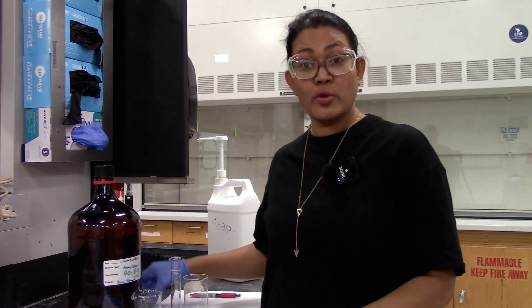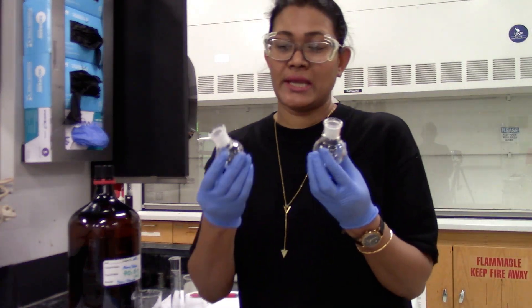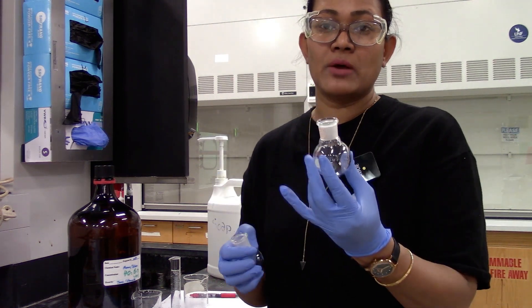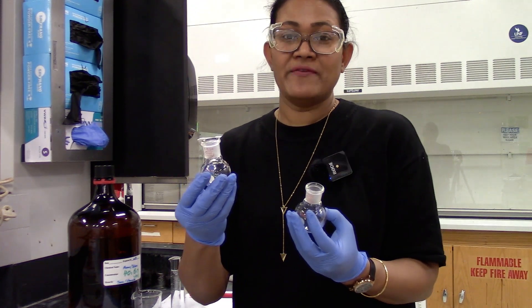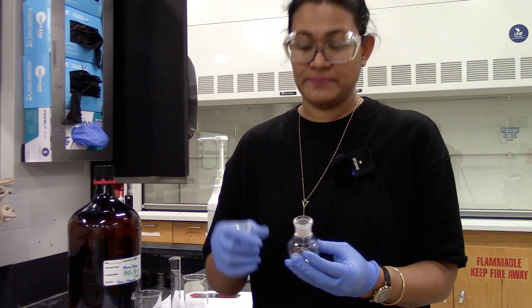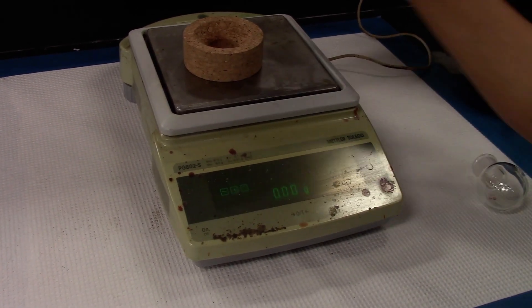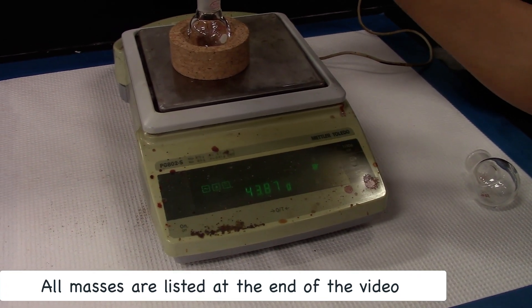To start with, we are going to measure the empty masses of our distillation and collection flask. Our distillation flask is a 50 ml round bottom flask and the collection flask is a 25 ml round bottom flask. Let's weigh these out empty. We are going to tare the balances. That's the mass of the 25 ml round bottom flask.